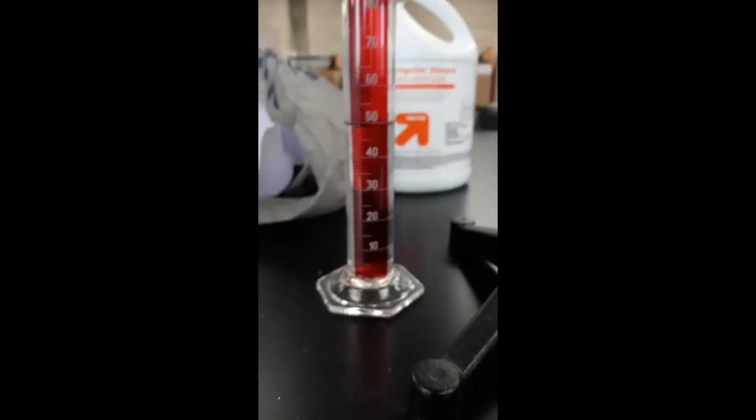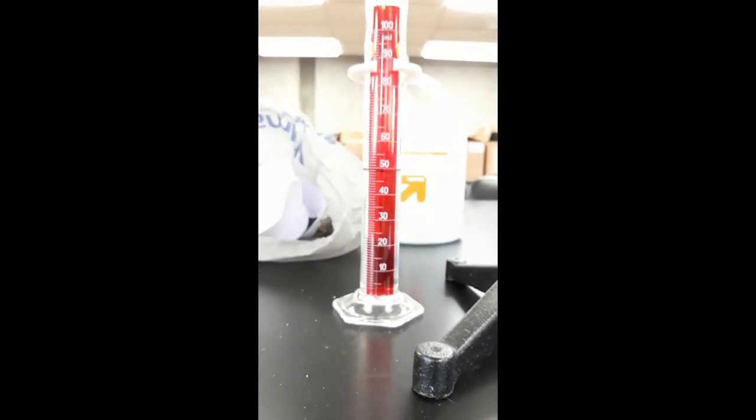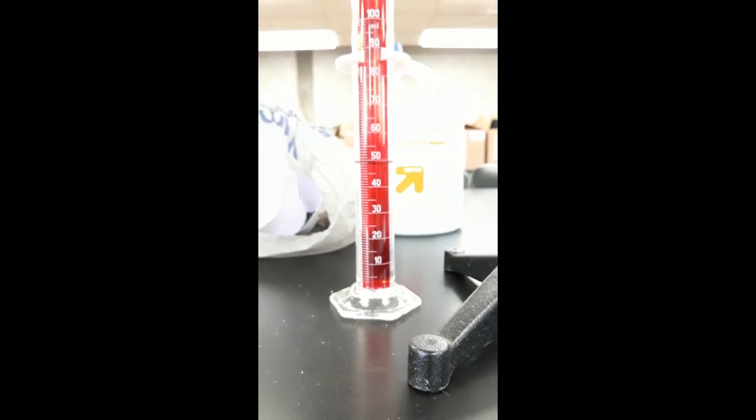Okay, so it's now five minutes, and this is the level with the two mils.